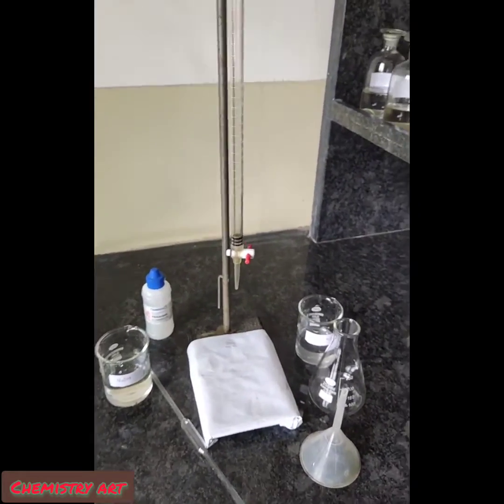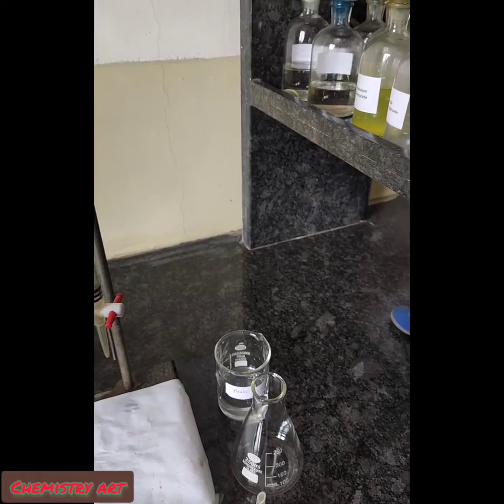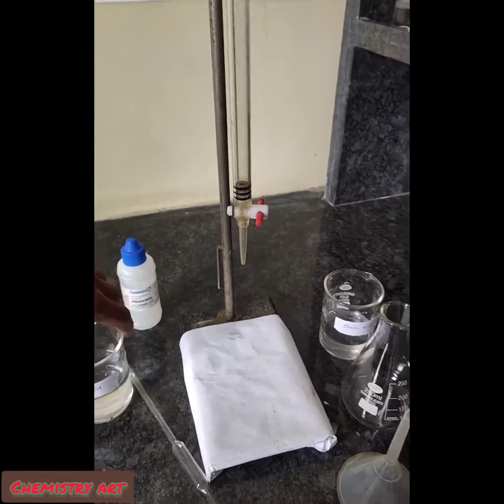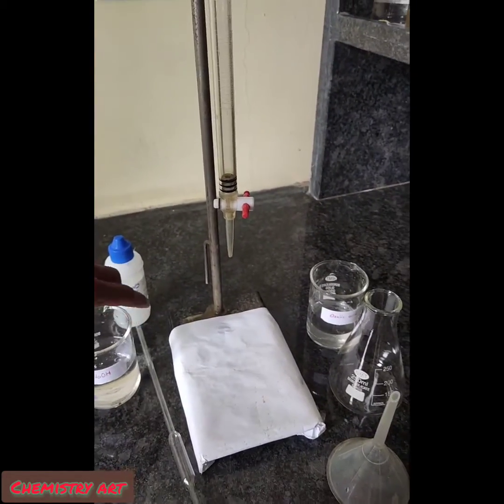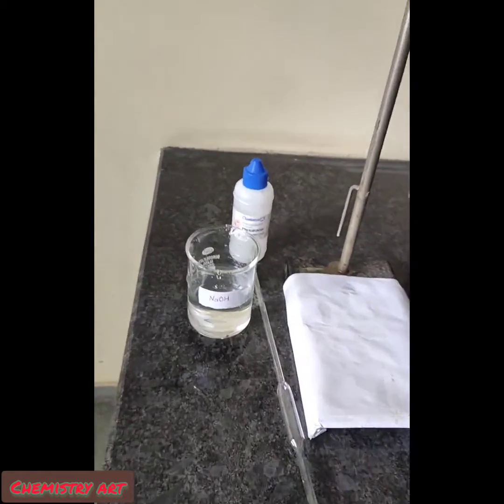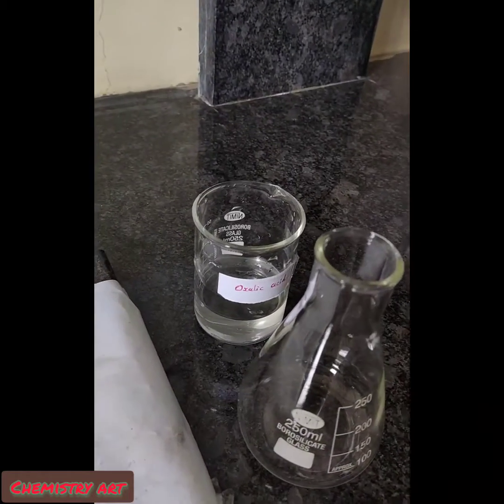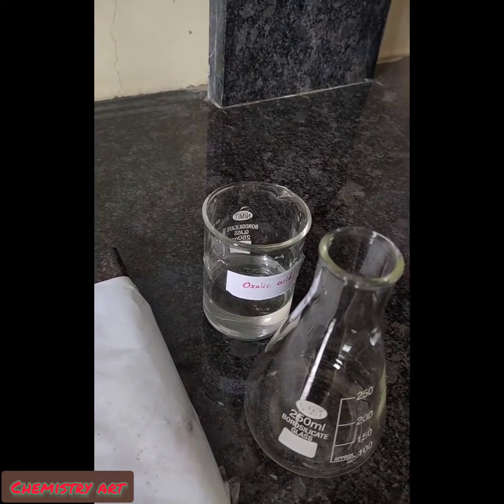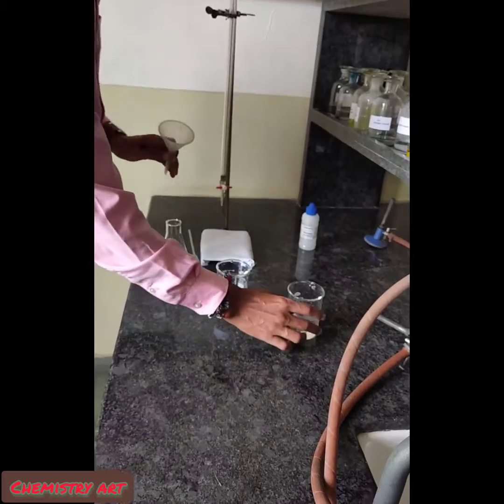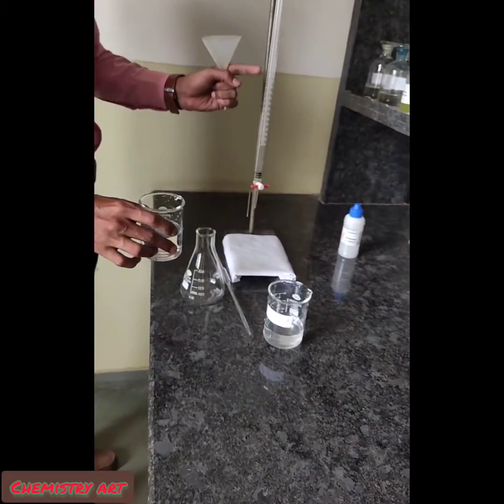Our aim is to find out the molarity of the NaOH solution with the help of the M/20 molar oxalic acid solution.